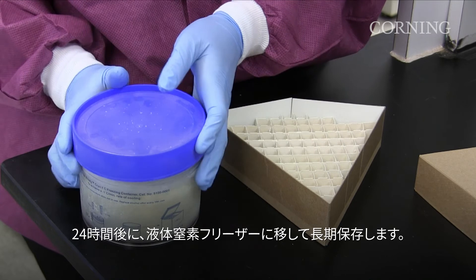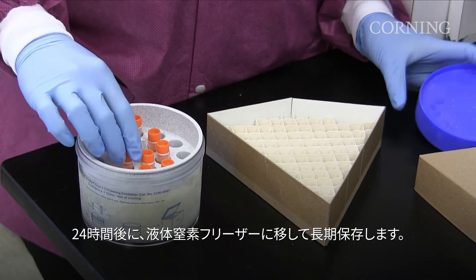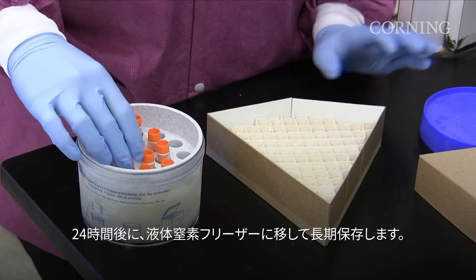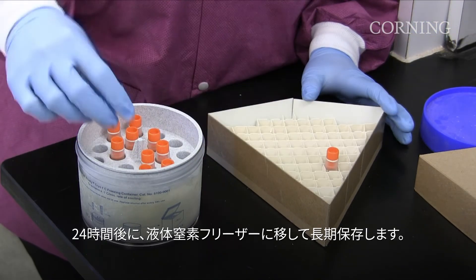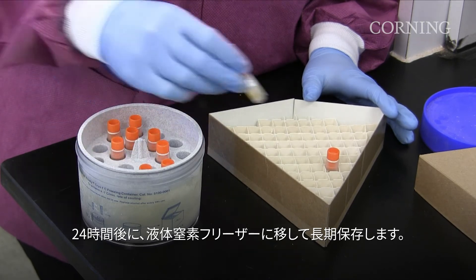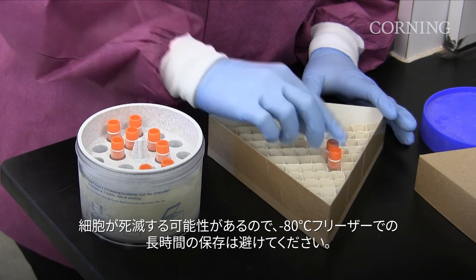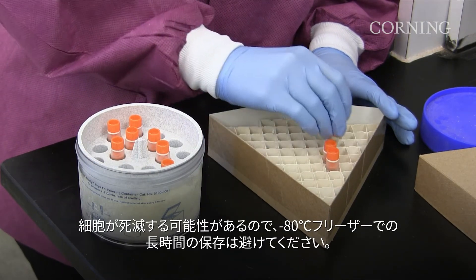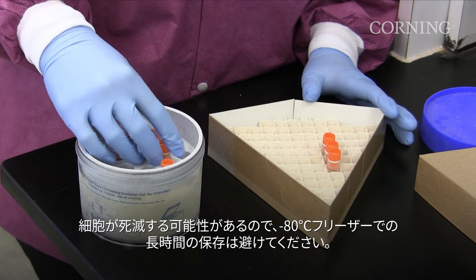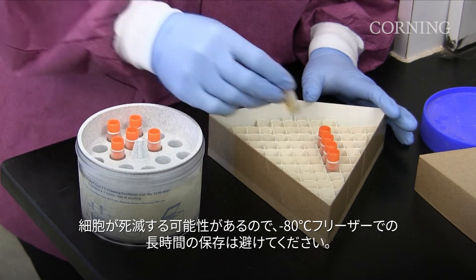After 24 hours, the cryogenic vials are ready to be transferred to a liquid nitrogen freezer for long-term storage. Avoid storing cells in the minus 80 freezer for long periods of time, as this may result in cell death.